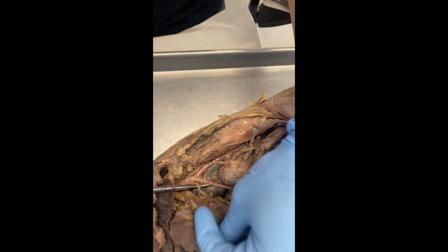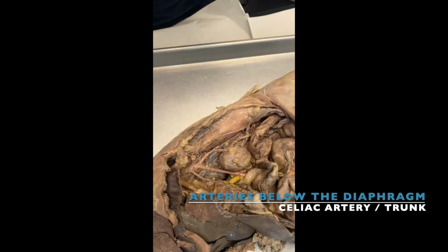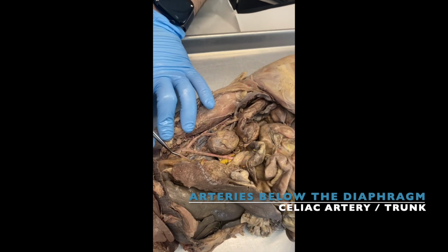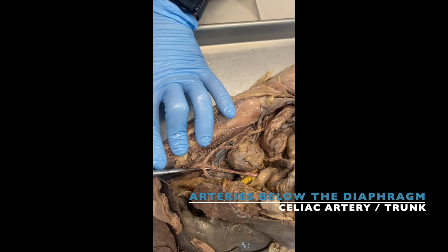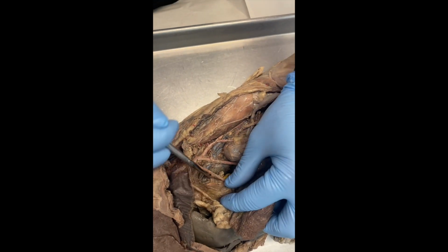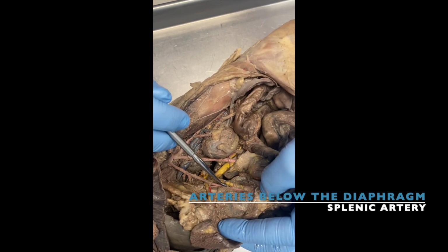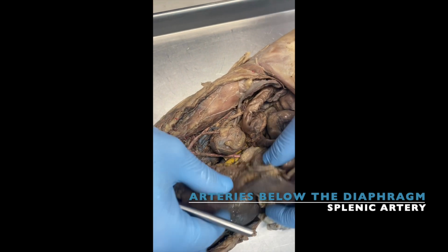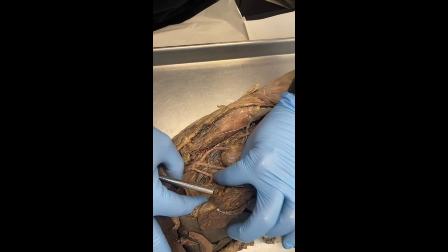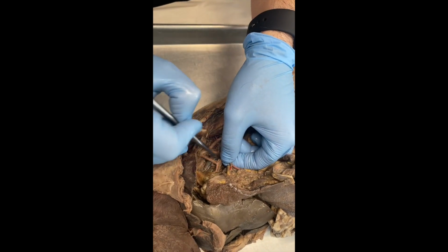So the first branch that we have here is the celiac. Remember that in the model it's just like a little thing sticking out? Oh, at the top. Yeah. But here we actually can see it. And then this gives off a few others. So this one goes into the splenic artery, which is this one here, because this is the spleen. Okay? Then we have two other ones that I think are right there.